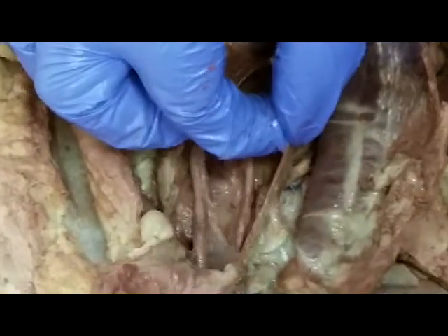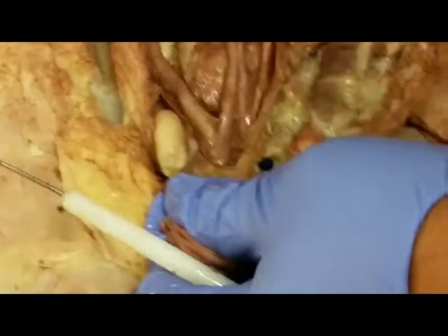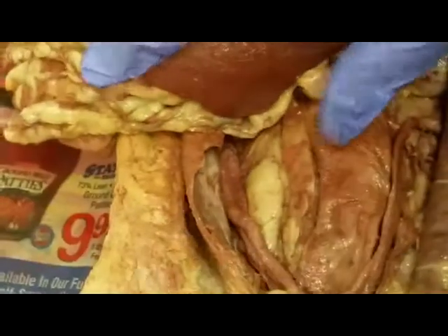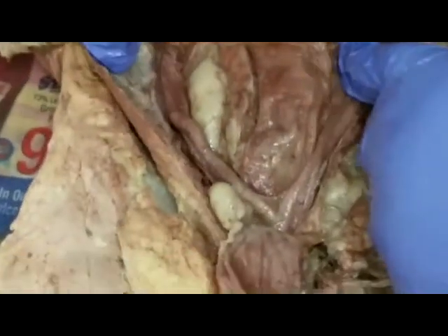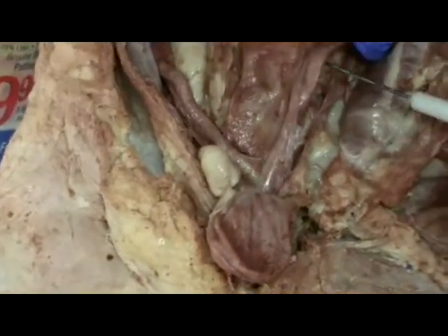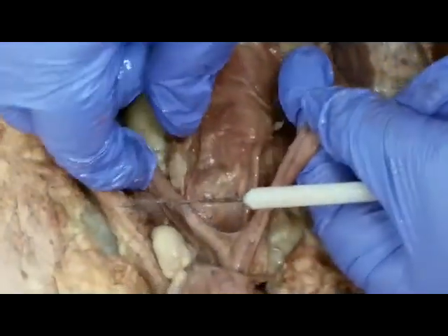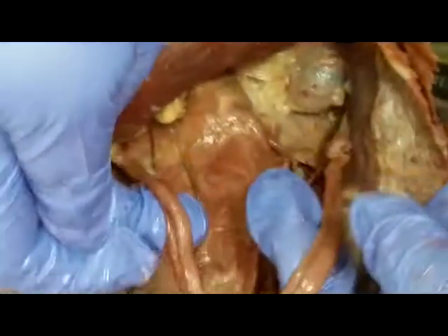Going from the kidneys up there, just showing it to you on one side, it empties into the urinary bladder. So the urinary bladder is testable. The ureter is testable. And now if you look at your sheet, the picture that I gave you, the cat is capable of having more than one, two horns. Babies at the same time, because these are the horns. They're not called fallopian tubes, they're called the uterine horns. And so they can have more than one kitten inside there.